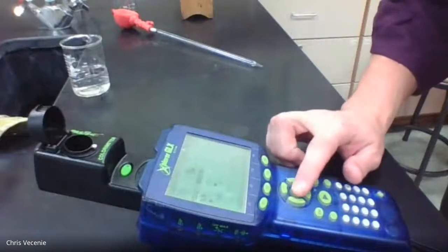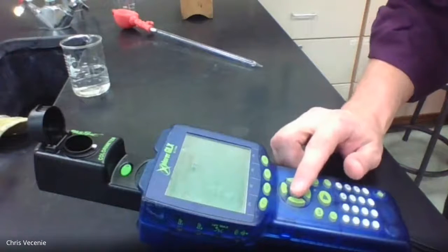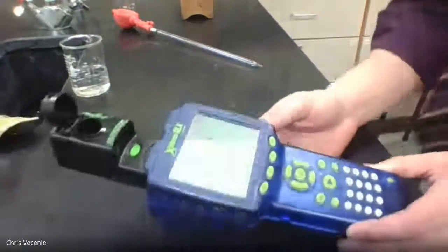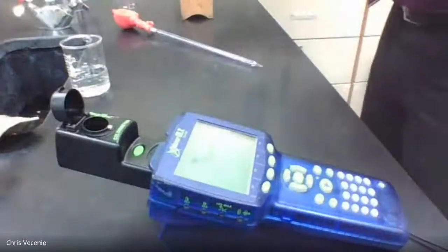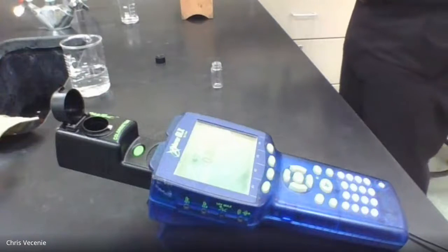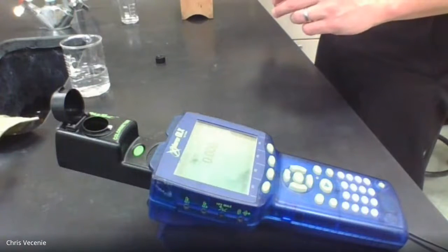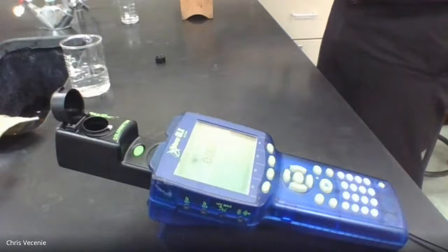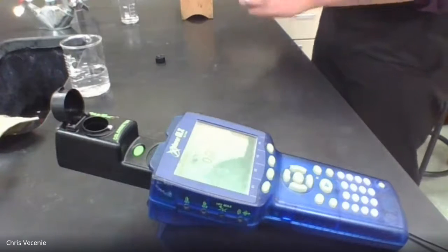All right, so I'm just setting my colorimeter here to read at the wavelength we want, which is 468. All right, and then live recording. All right, so right there you can see 0.00. Then what we'll do is we'll take our cuvette and I'm going to put a sample of our first solution in there. And we're going to get the absorbance of it. Okay. And I'm going to fill it as much as I can. I have more in my test tube than will fit in the cuvette. So no big deal. I just leave the extra back there.